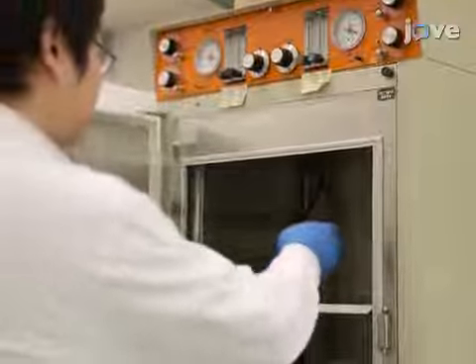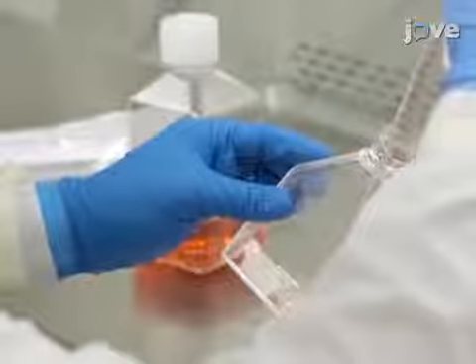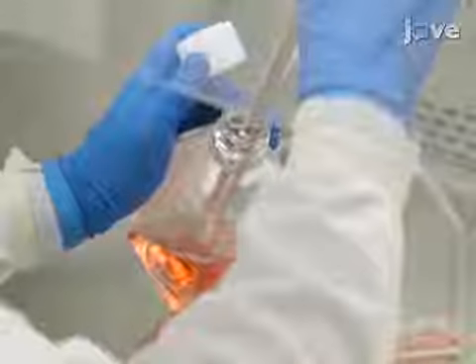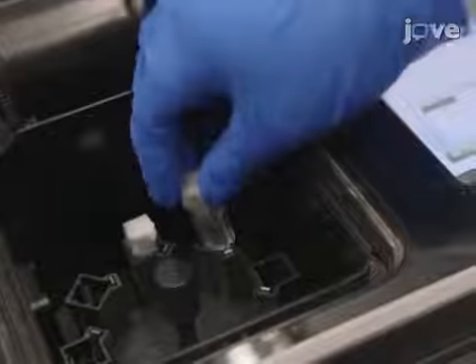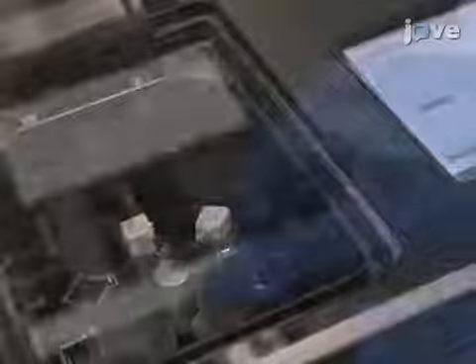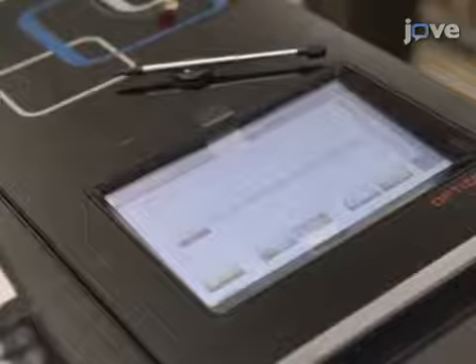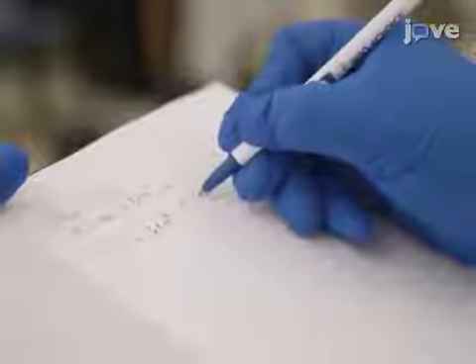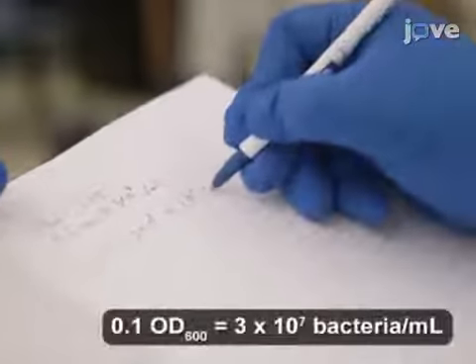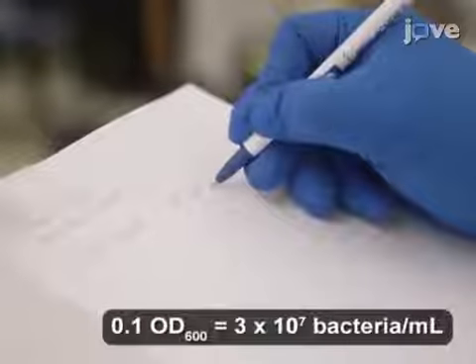Grow THP1 cells in RPMI complete medium while maintaining a cell density of 0.2 to 1 million cells per milliliter of medium between passages. Use a spectrophotometer to measure the OD600 of an actively growing bacterial suspension. Then calculate the bacterial density using the conversion factor of 0.1 OD600 equals 3 times 10 to the seventh bacteria per milliliter.